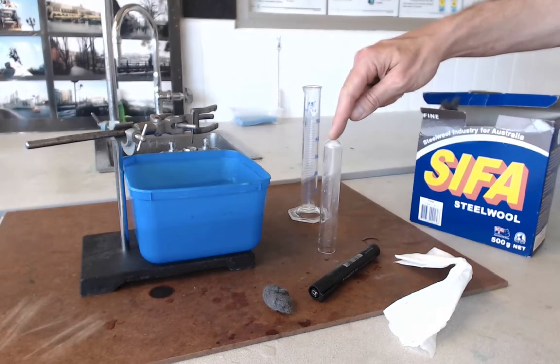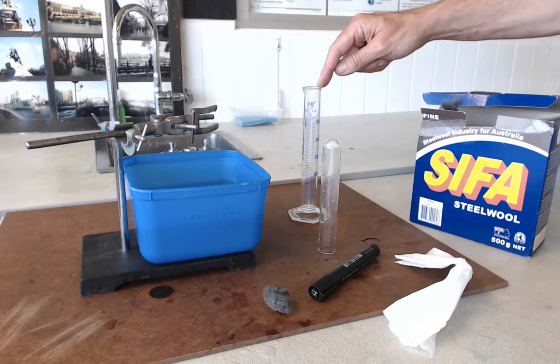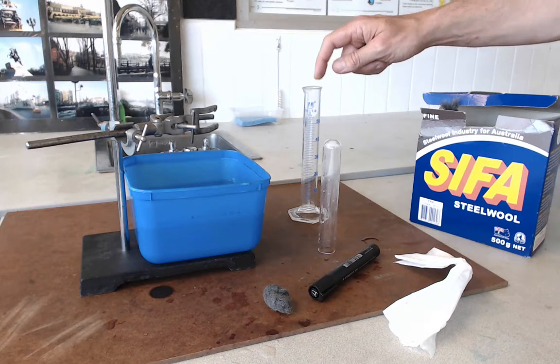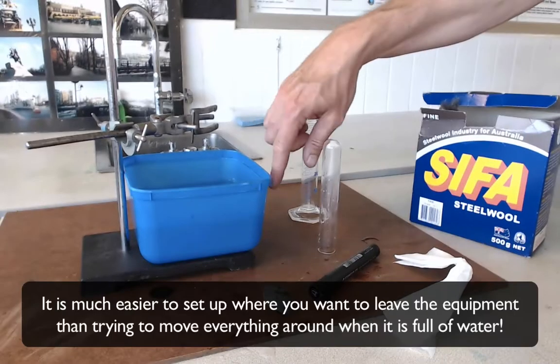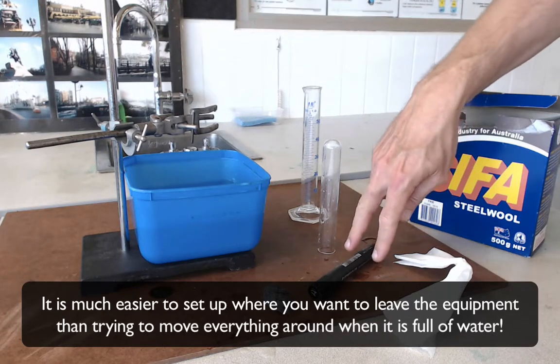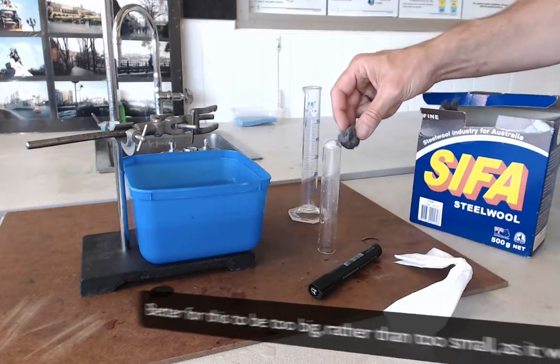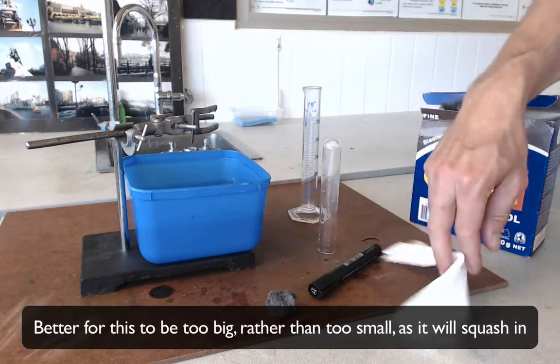You need a boiling tube where your reaction is going to happen. You need a measuring cylinder to measure some liquid levels at the end of the practical. You need an ice cream tub that's about half full of water, a clamp stand with a boss and a clamp, a texter, some steel wool — a ball of steel wool that's about the same diameter as your boiling tube — and some paper towel.